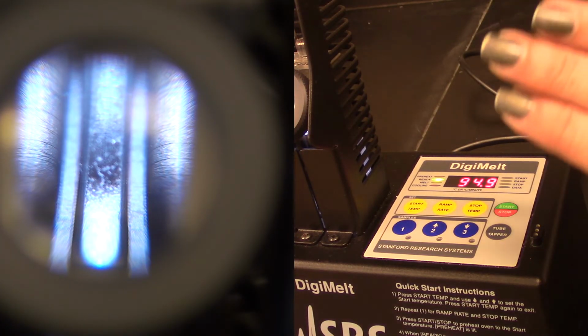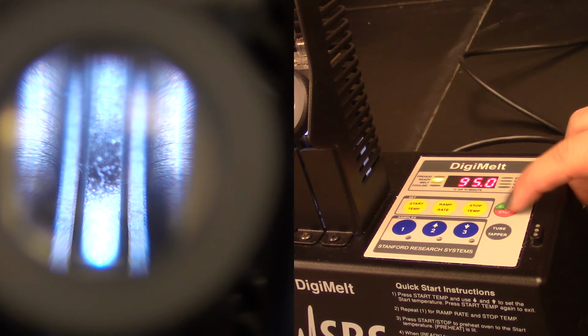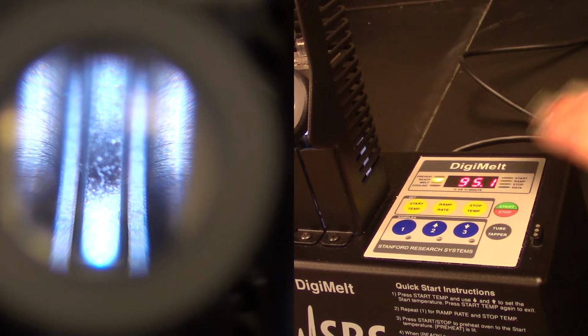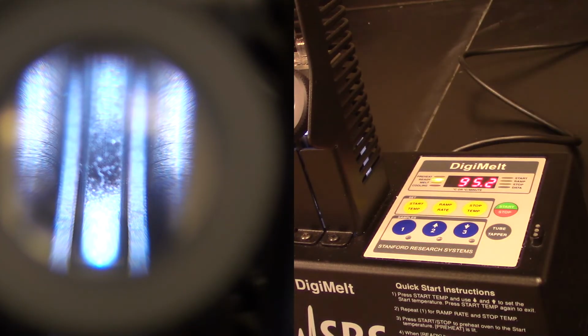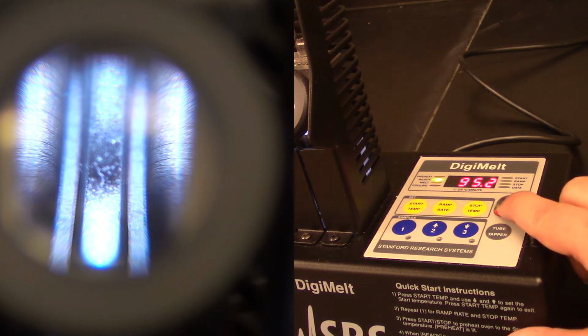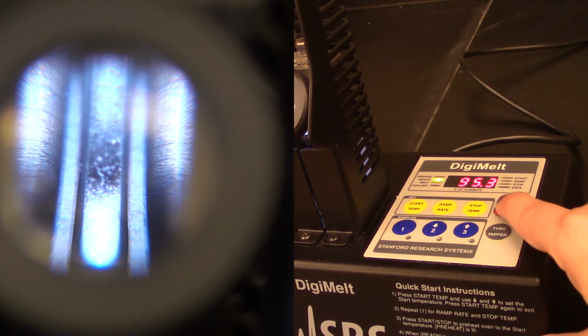So to bring this into the raise the temperature mode, all you have to do is hit the start and stop button. This is really the only button that you need to press throughout the entire routine. So I'm going to hit start, let it start heating up, and watch for it to melt. I'm going to record when I initially see liquid and then when the rest of the solid has melted as well, and that's my melting point range.